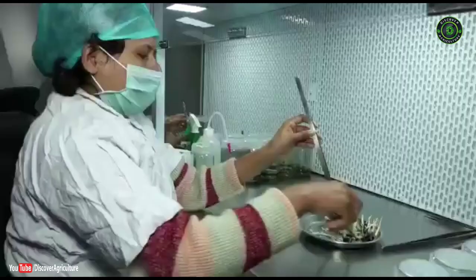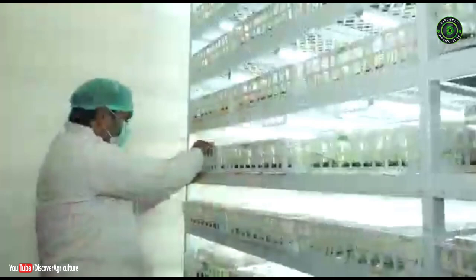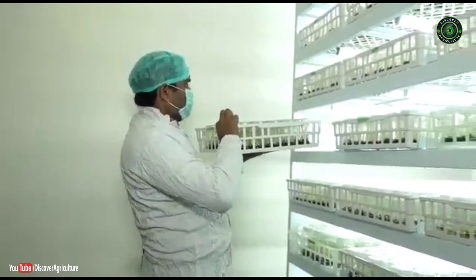Plant tissue culture is a collection of techniques used to maintain or grow plant cells, tissues or organs under sterile conditions on a nutrient culture media of known composition. It is widely used to produce clones of a plant in a method known as micropropagation.